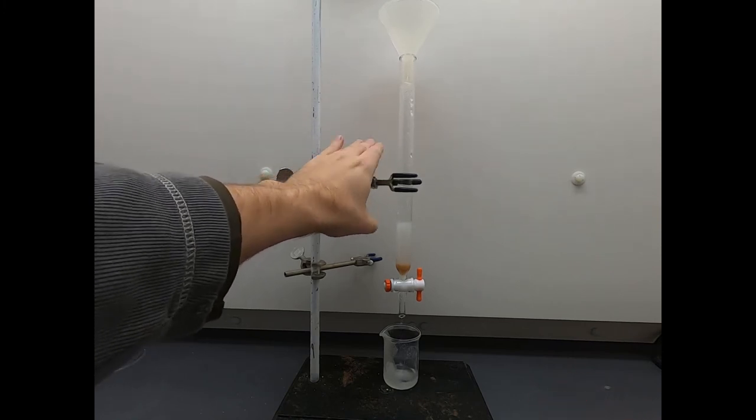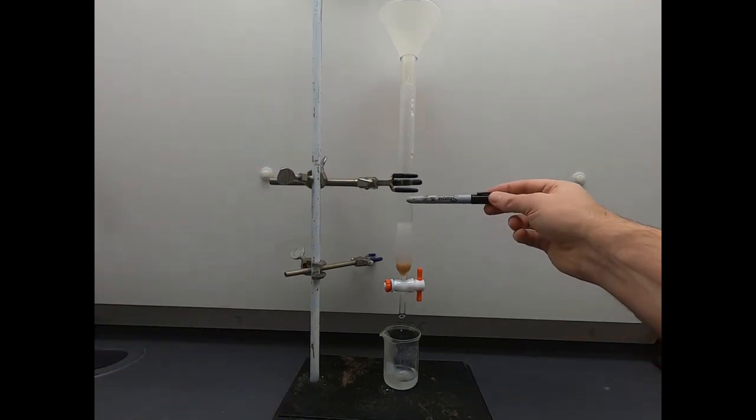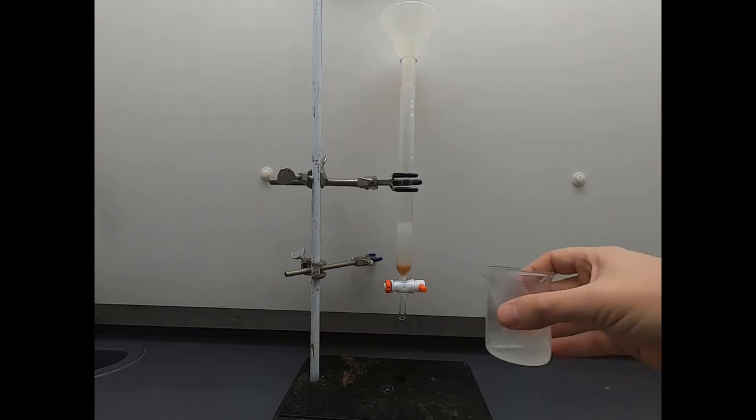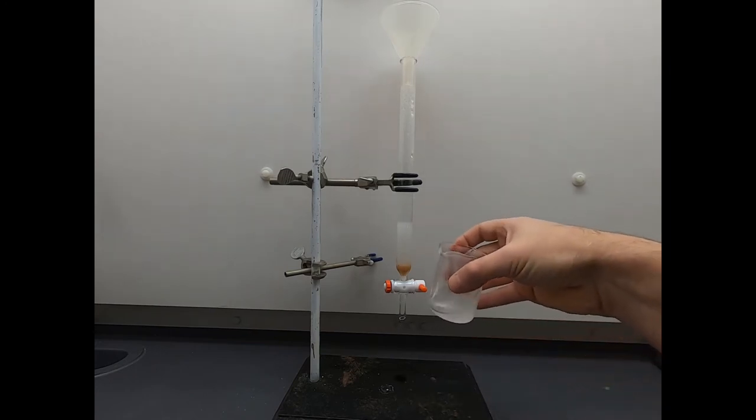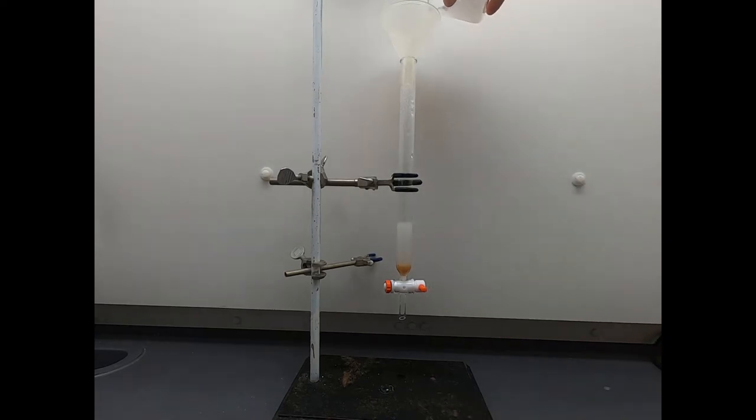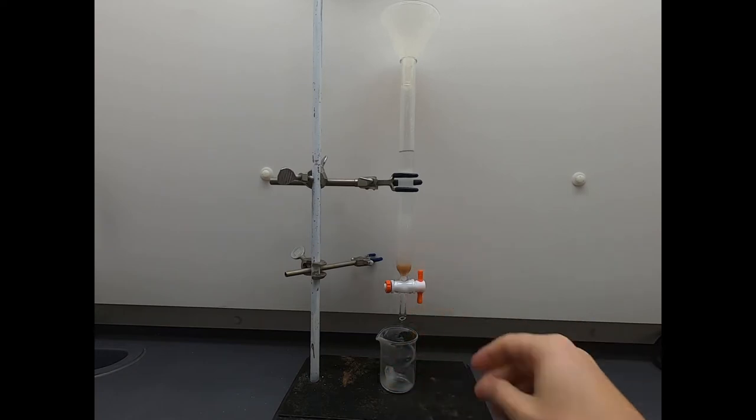So it's a little tedious. Tap, tap, tap. That's good enough. Now really, I want a little bit more silica gel than this. I'm not going to try to run a really long column, but that's a good start. And now I'll swirl this again. This is called a slurry when you get this suspension of silica gel and your mobile phase. In my case, hexane. And we'll dump some of this down. Let's see what that did. I think that's going to be enough for our demonstration purposes.